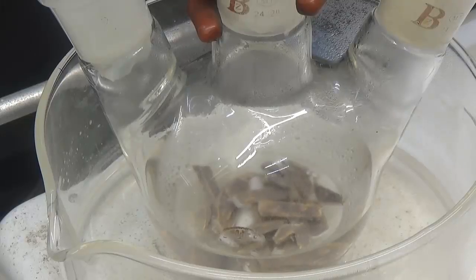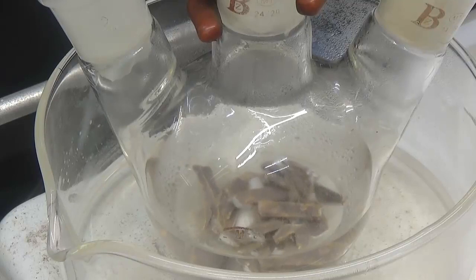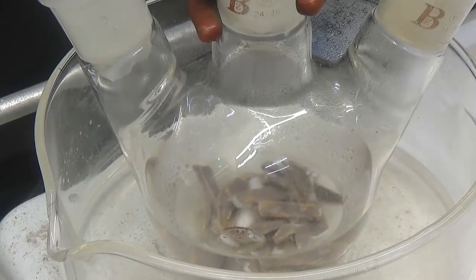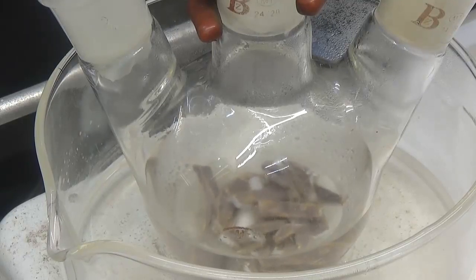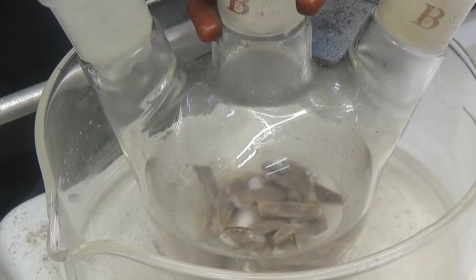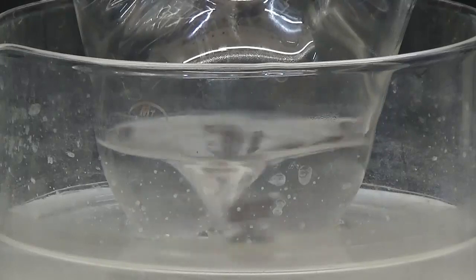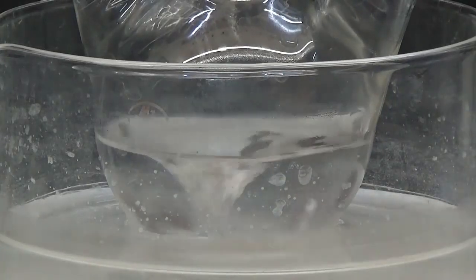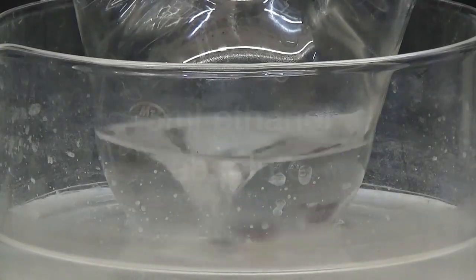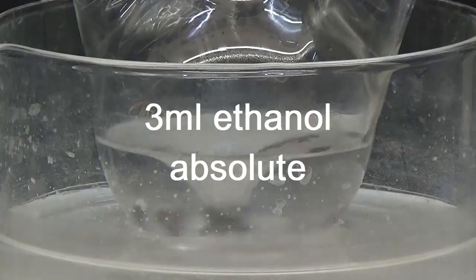For sodium ethoxide to form, ethyl acetate must contain 3% ethanol and be free of water. A commercial ethyl acetate was used, to which 3 ml of absolute ethanol was added.